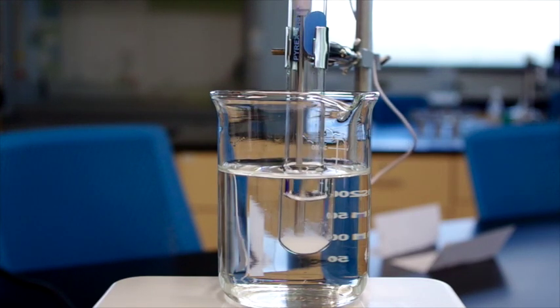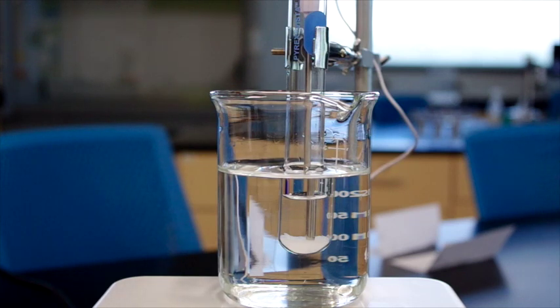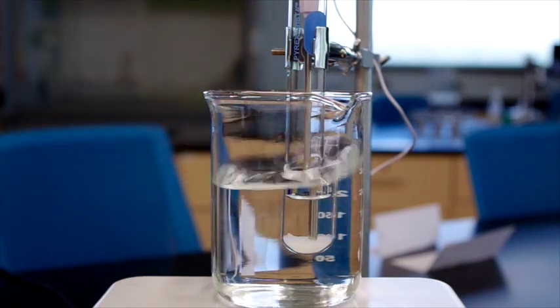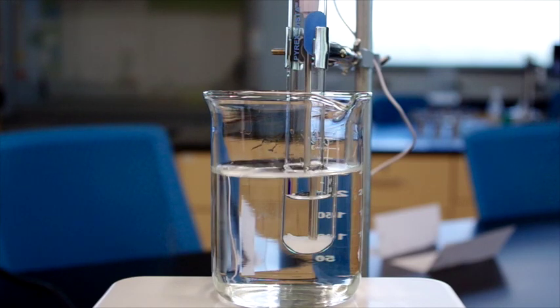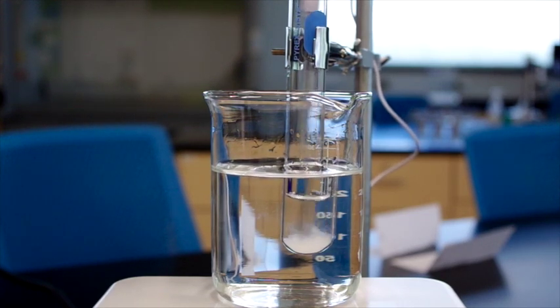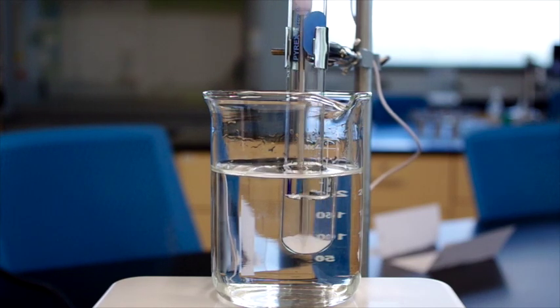Pile keeps getting smaller and smaller, gradually. how much thinner the salt is getting. Still have one big chunk floating around in there though.